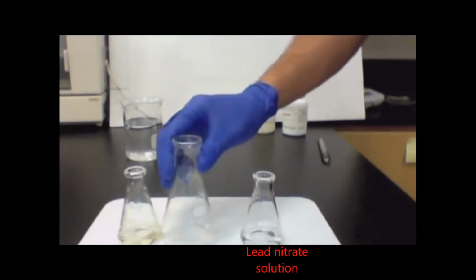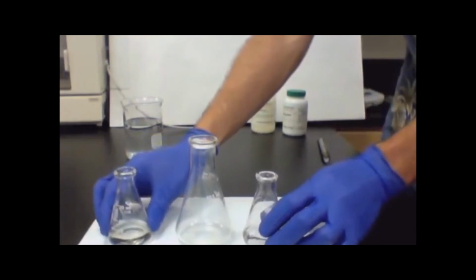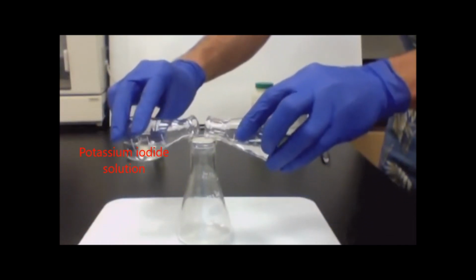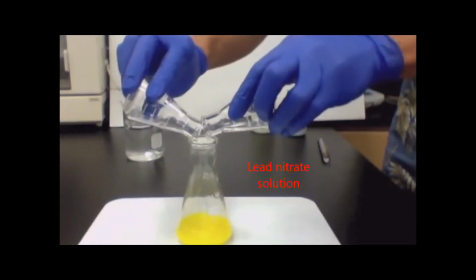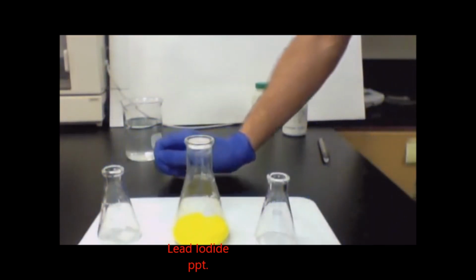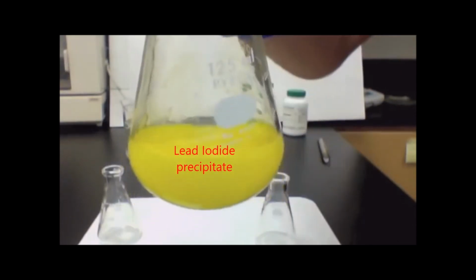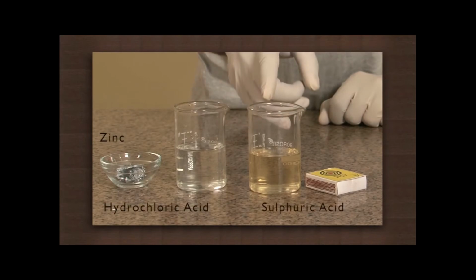We have two conical flasks. In the first conical flask, we have potassium iodide. In the second conical flask, lead nitrate. Let us mix these two solutions together, and you can see what happens. So you got a yellow precipitate of lead iodide. Let us see the next reaction.